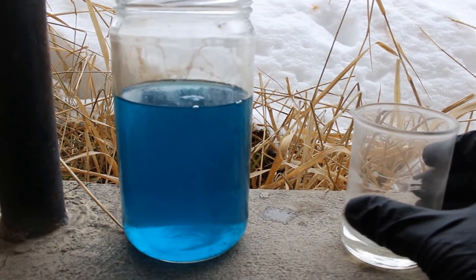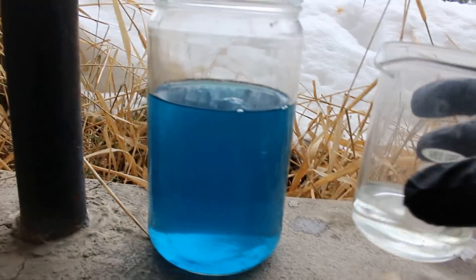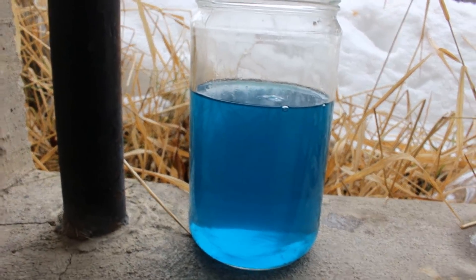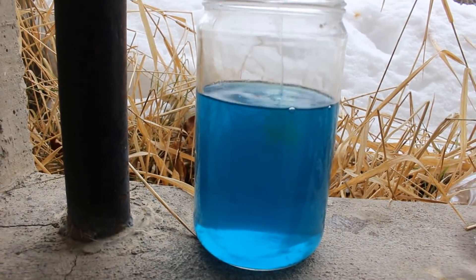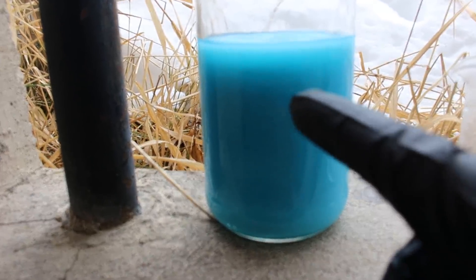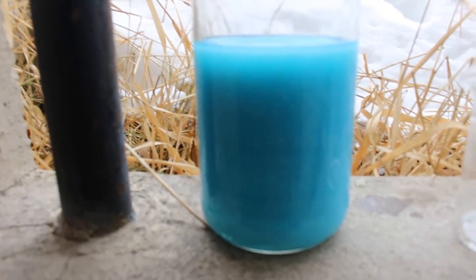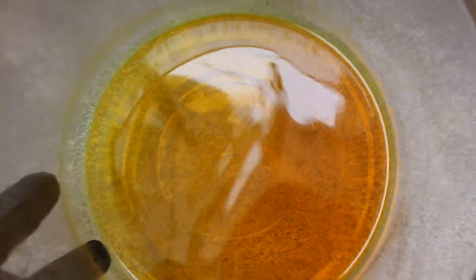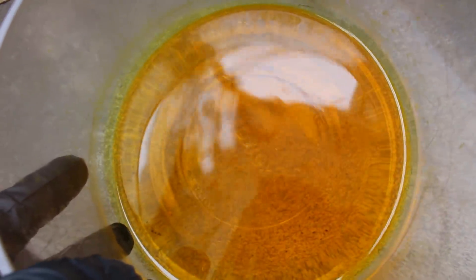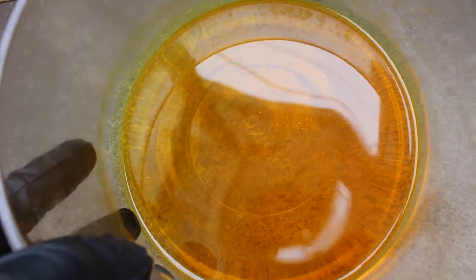Silver is incredibly insoluble if there's chlorine in the solution, so I've got some hydrochloric acid here. I'll put this in and you'll watch the silver fall out. There it is — looks like cottage cheese clumping up in there. That's your silver chloride. There's just a tiny little bit of silver in there, and that's what I was trying to remove by putting it through acid again.